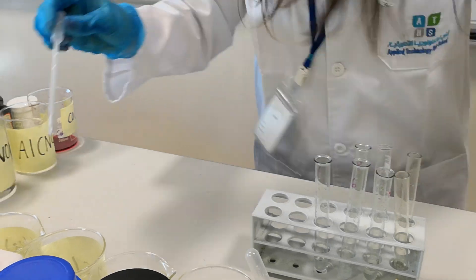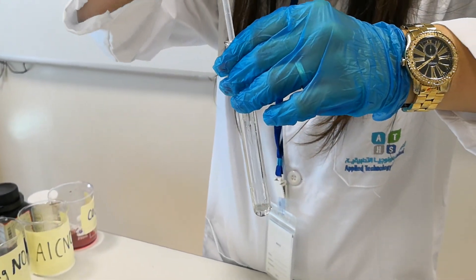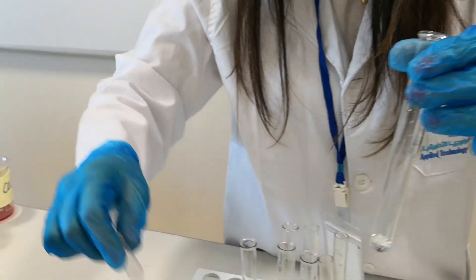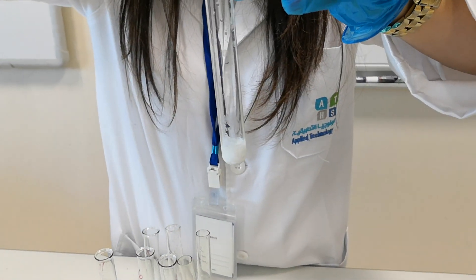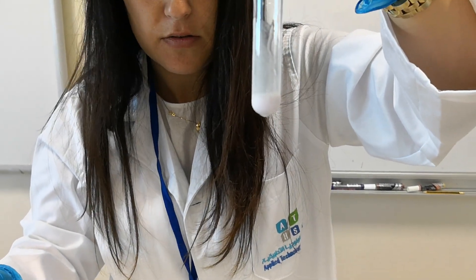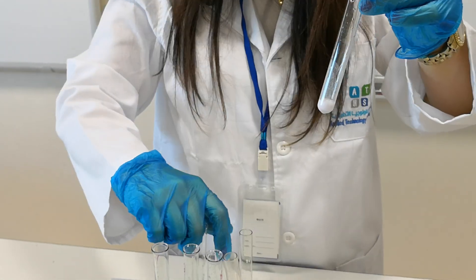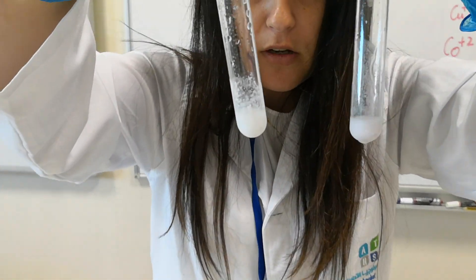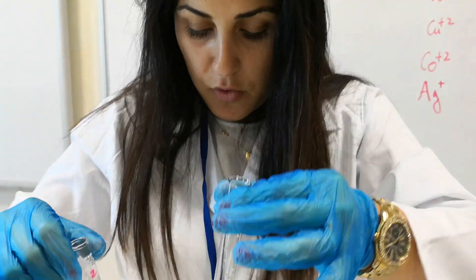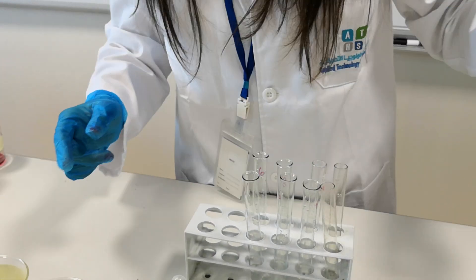This is a solution of lead nitrate. Adding sodium hydroxide — it also gives a white precipitate. So here we have another white precipitate. We need to do some more tests to differentiate between lead and calcium.